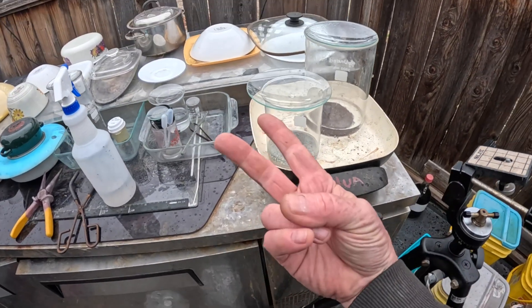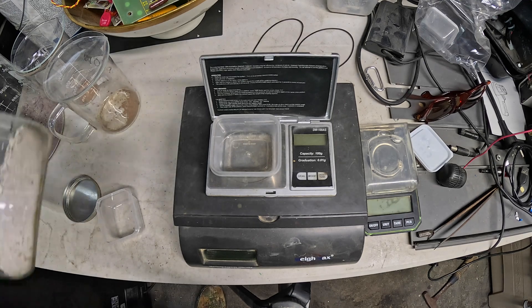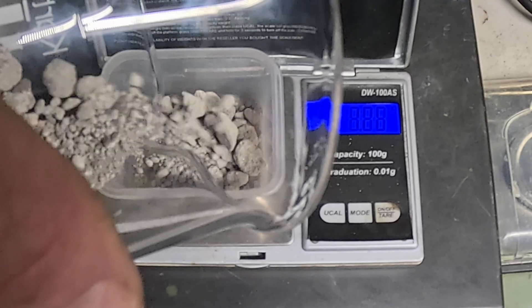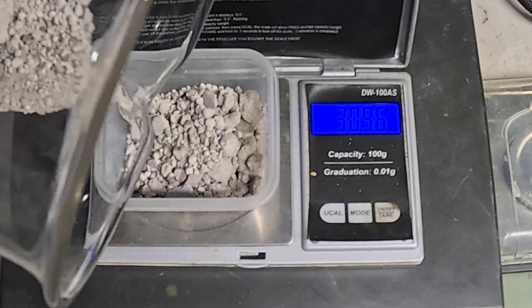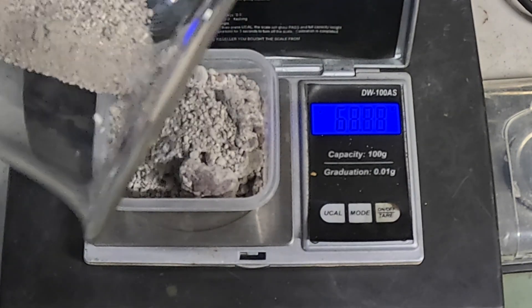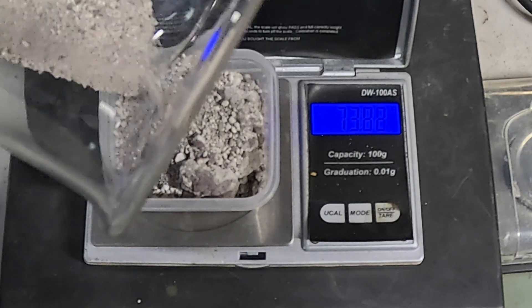Anyway, got to dry it up one by one. Okay, I'm going to weigh this stuff in. It's not going to fit in one container, I'm pretty sure. We can get another ounce in there, I'm pretty sure. Maybe straight.